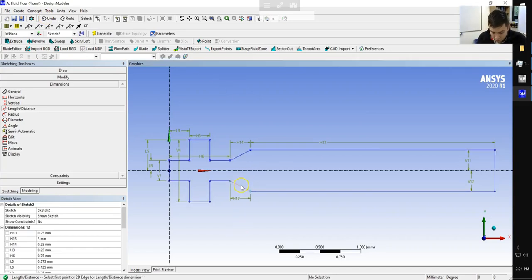The other one we have to define is this distance here, and that takes care of it. So we've gone ahead and added dimensions. Notice we didn't plug in any values for those dimensions. We didn't actually change the sketch at all. What I would say is you don't necessarily have to have your sketch fully defined, but you do take the risk that there's potential ambiguities when someone else is trying to implement your system. So I'll obviously be posting a PDF with all of the dimensions included here. But at this point, we're done with our sketch.